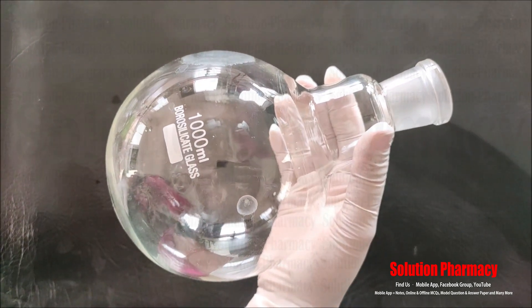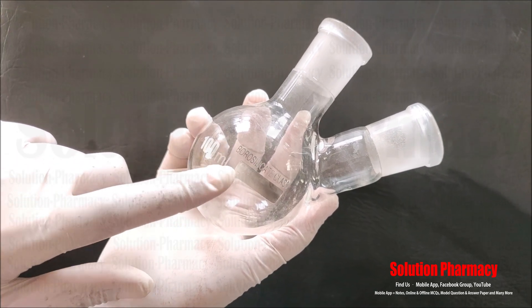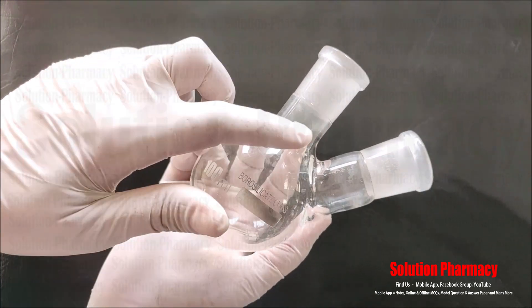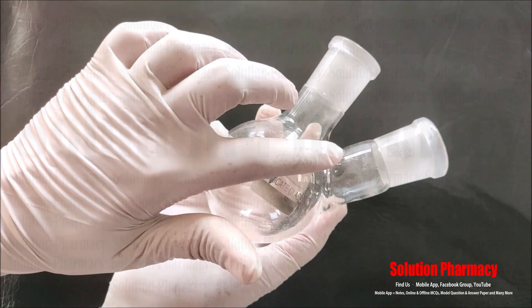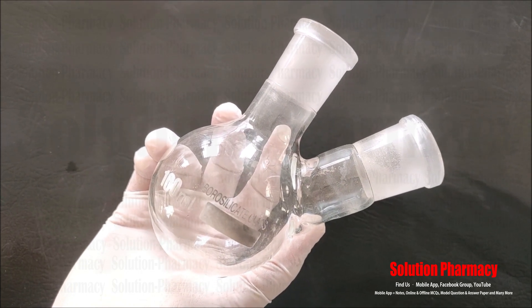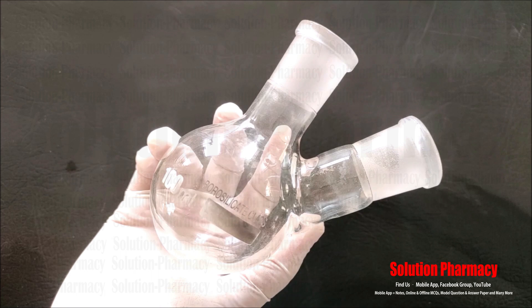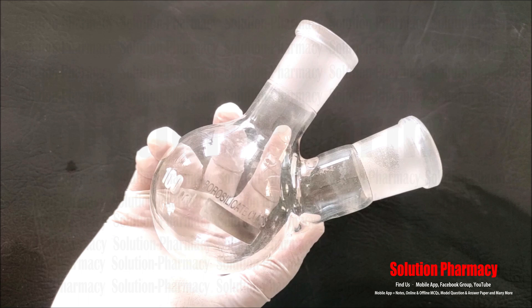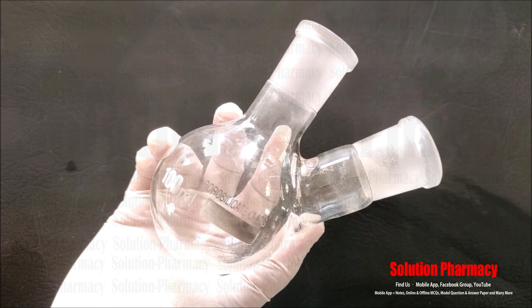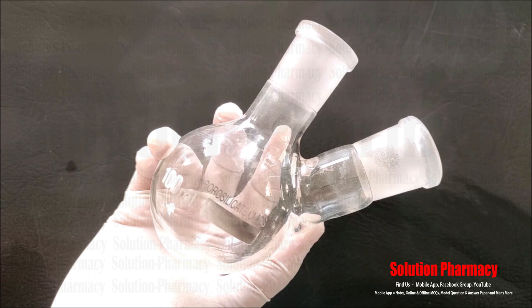This is also a round bottom flask of 1000 ml made of borosilicate glass, with a joint for attachment, used for the same purposes. Next, this glassware is called a two-neck round bottom flask — it is 100 ml, made of borosilicate glass, with two necks. This type of flask is generally used in organic chemistry experiments — during a chemical synthesis or reaction, a condenser is fitted to one neck and a thermometer is inserted into the other neck to monitor and control the temperature throughout the process.